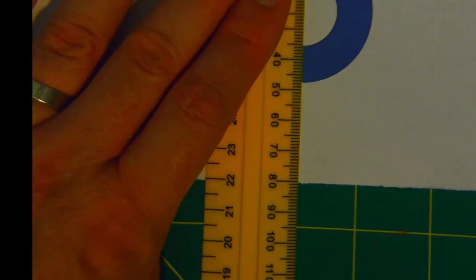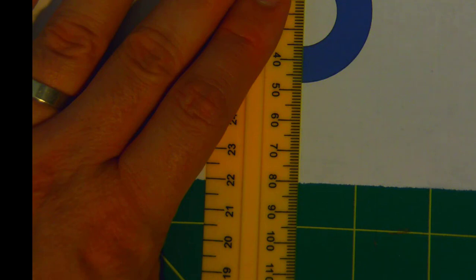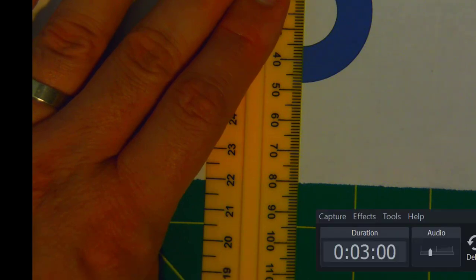And here we have the measure for the diameter of the circle. The camera is adjusting a little bit, so we'll just wait on that to come into focus. Remember that we are here using the outside diameter. Also, again, as always, please remember to guess the last digit.